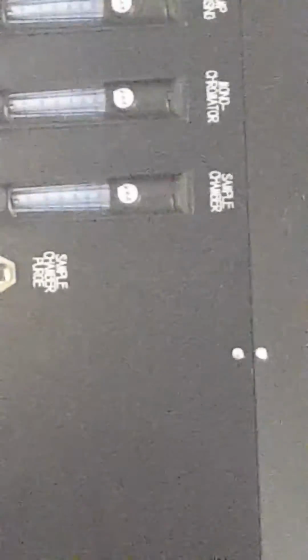Secondly, the next important is the monochromator, because the light path comes in that big unit and travels 2 meters maybe. So therefore it encounters a lot of gas. Here, however, once we've got the monochromator cleaned out, and now those monochromators are remarkably well sealed. I don't know for sure on that unit, but I would guess that it's probably 40 years old, or maybe 50. It's a superb instrument, and we clean them and make sure they're perfect and so on, but they're sealed.